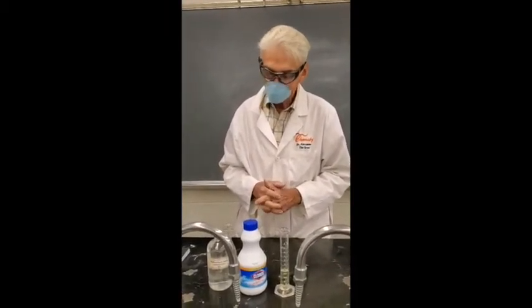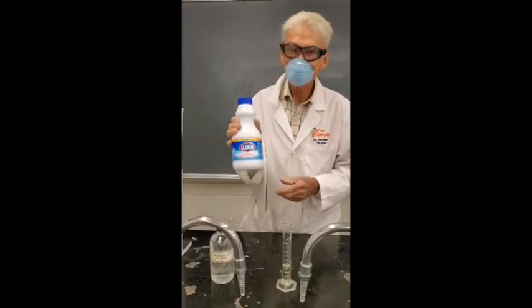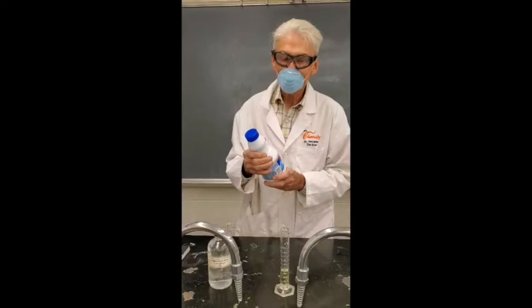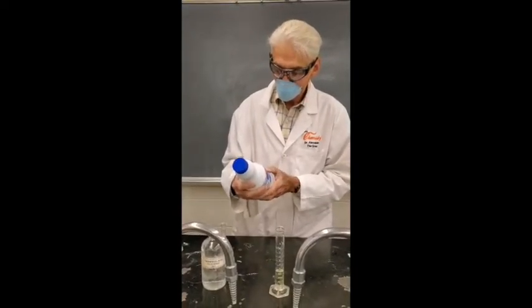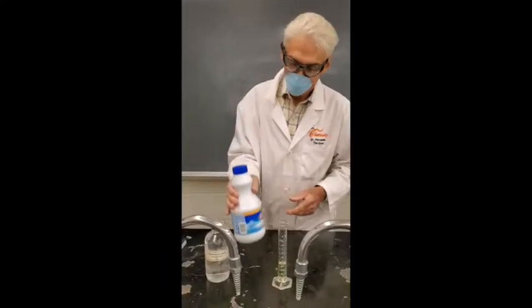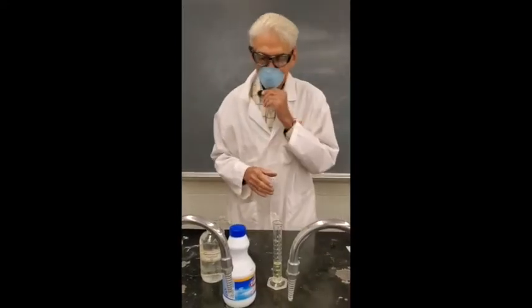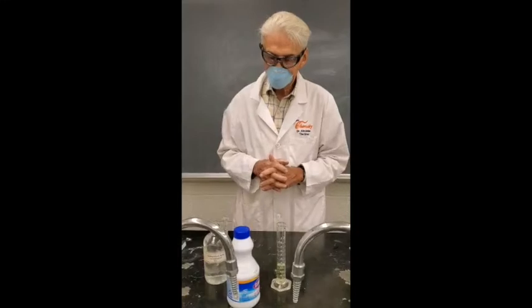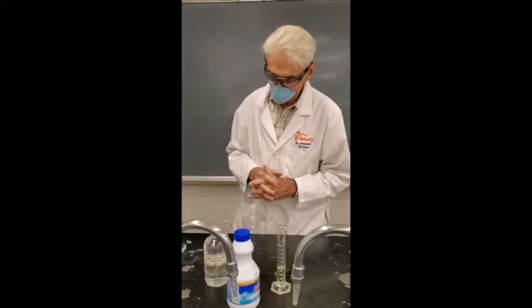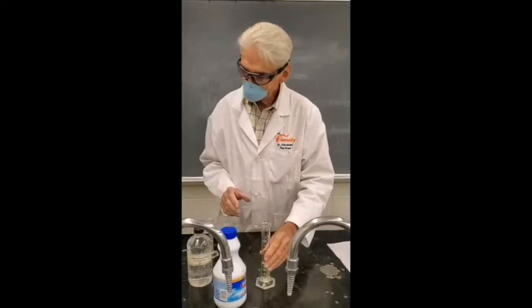So what we're going to do is use a chemical reaction between a common material you can get at grocery stores, which is Clorox. Clorox is actually a solution of sodium hypochlorite, NaClO, and this particular one is concentrated at 7.5%. I'm going to take that compound, and it reacts with concentrated hydrochloric acid to make chlorine gas. You're supposed to calculate from the equation how much of the 12 molar hydrochloric acid I'm supposed to use, and I'm going to use that amount right now.